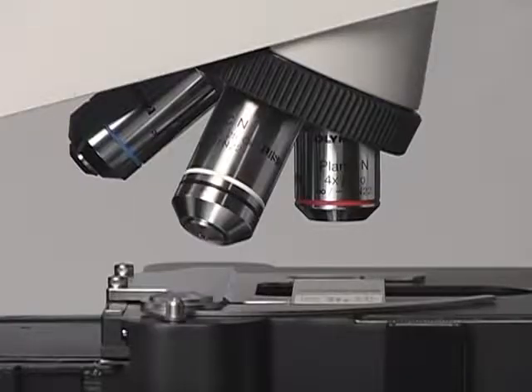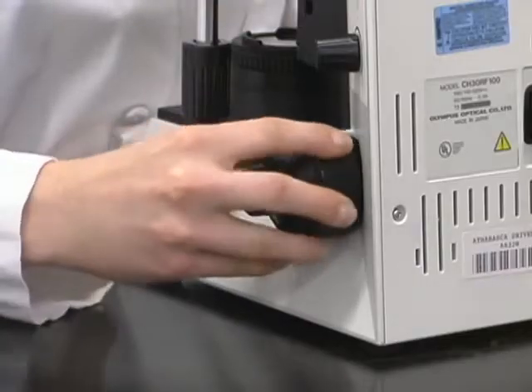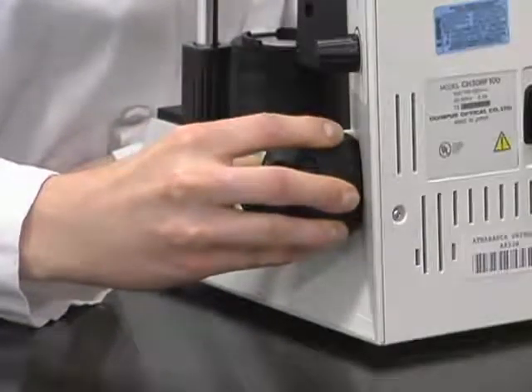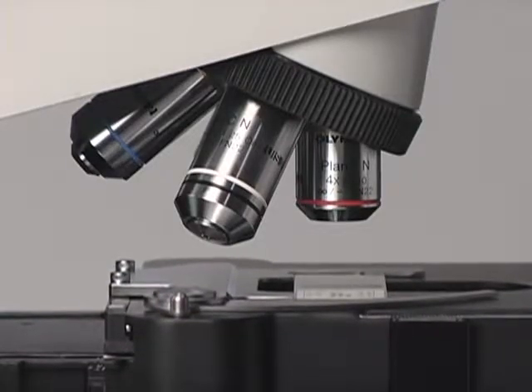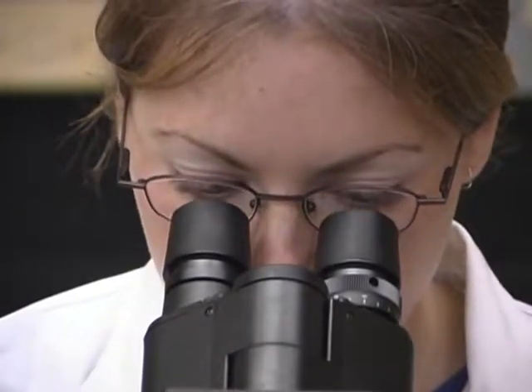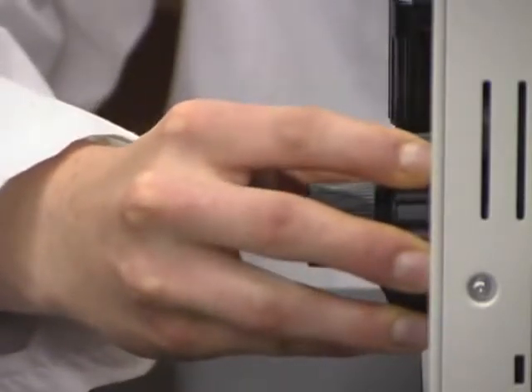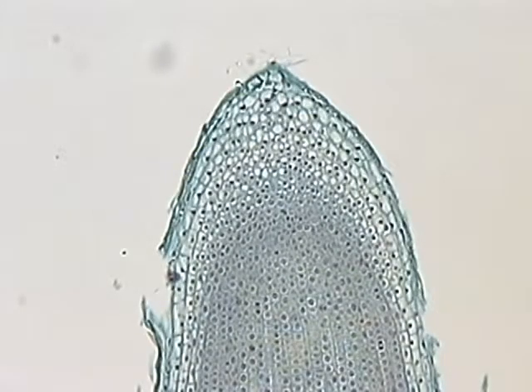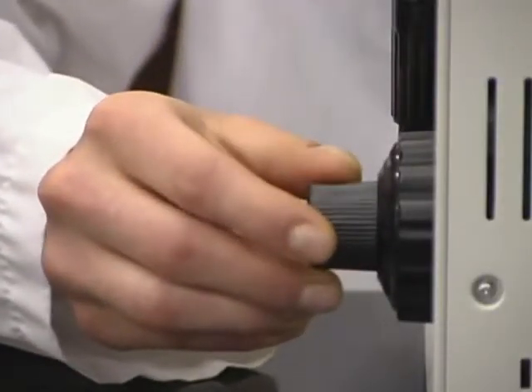Observing the slide from beside the microscope is the best way to prevent breaking the slide with the objective lens. First, minimize the distance between the object and the lowest power objective lens with the coarse focusing knob. Continue to decrease the distance until the objective lens nearly touches the slide or until the microscope hits its preset stop. Then, while observing the specimen through the ocular lens, increase the distance between the object and the objective lens with the coarse focusing knob until the object is in approximate focus. After that, move the fine adjustment knob up or down to obtain the best focus.